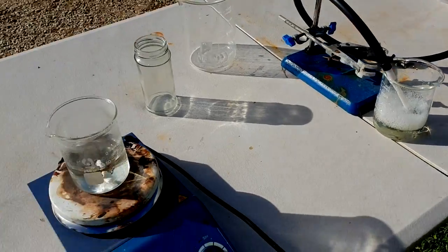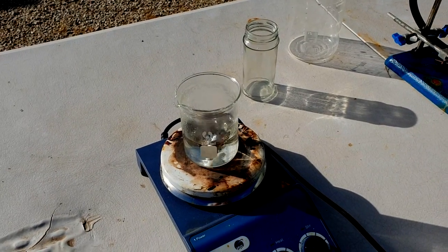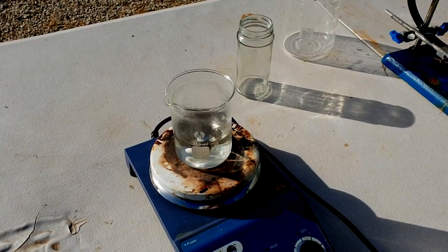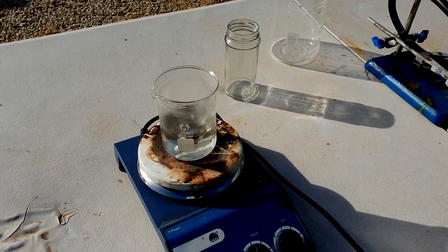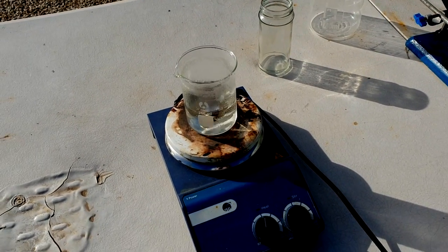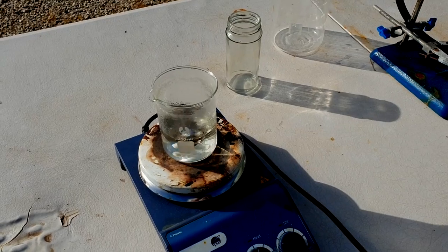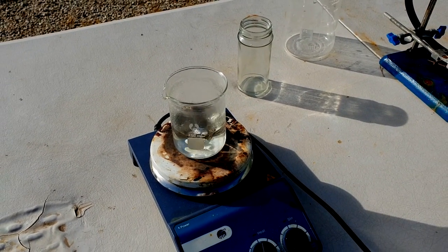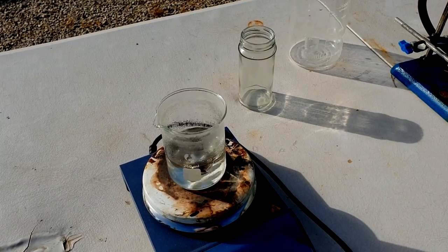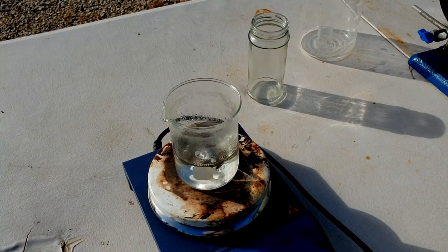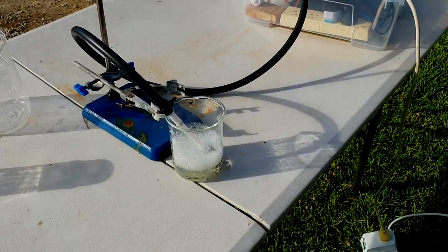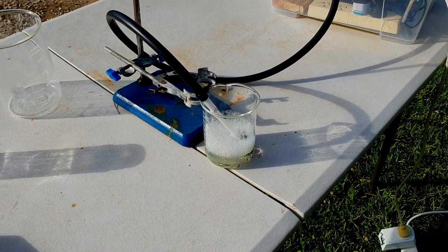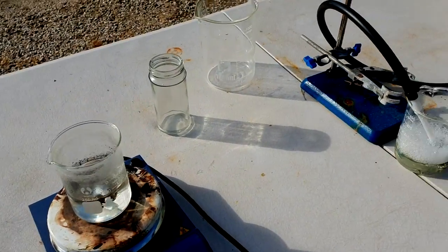While this is going on, I've got 100ml of ammonia solution that's just boiling down. I haven't added anything to this. What we expect is this to boil dry and there'll be no residue left over, because both the ammonia and the water should just boil off. But, it's good to just confirm this, because it's my bottle of ammonia that's been sitting there for a while, so it could have some crap in it. Hopefully, there'll be nothing in there. And then, when we boil this solution down and we get some solid out, we know the solid is only there because we've added the ozone.